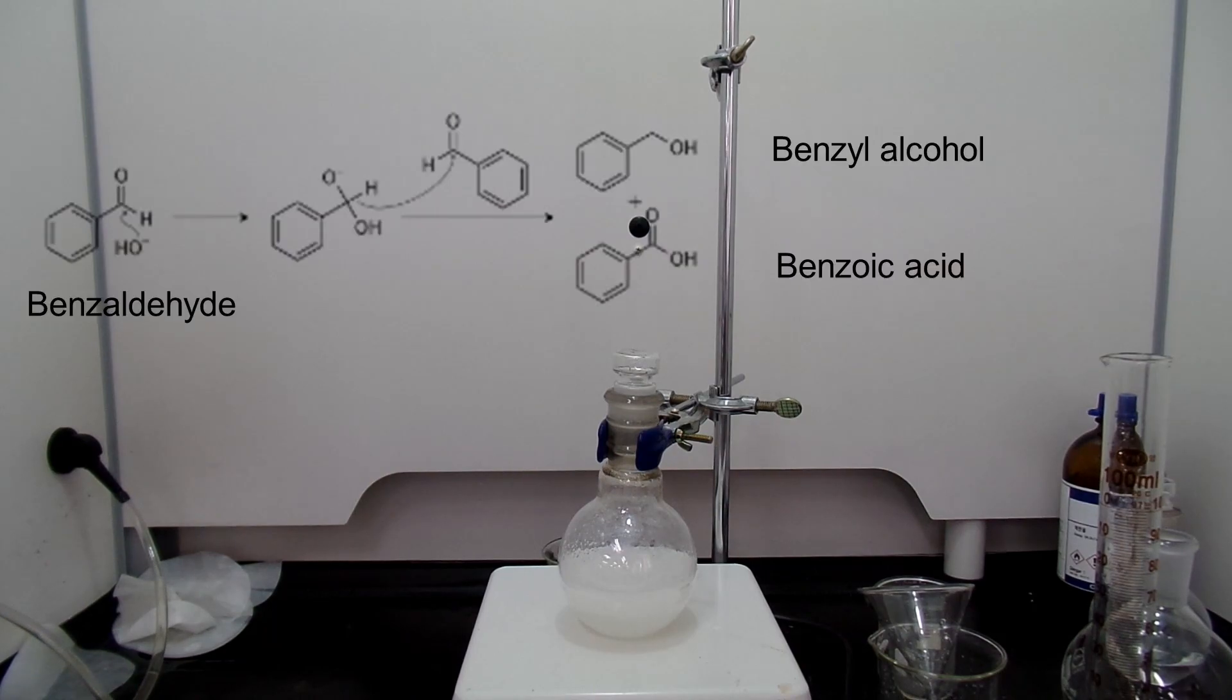The unique thing about this reaction is that the benzaldehyde used is both oxidized and reduced. You don't see this kind of reaction where two same molecules get oxidized and reduced. In strong basic conditions, two benzaldehyde molecules are reduced to benzyl alcohol and oxidized to benzoic acid.